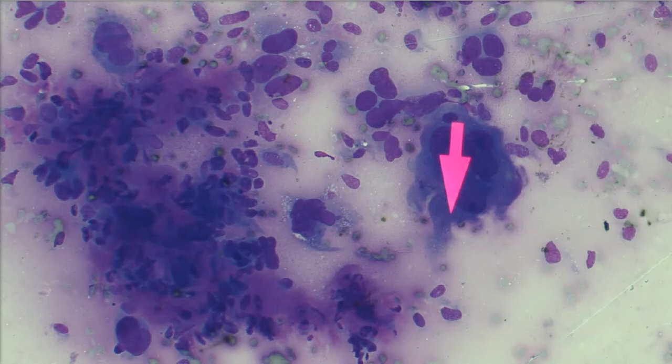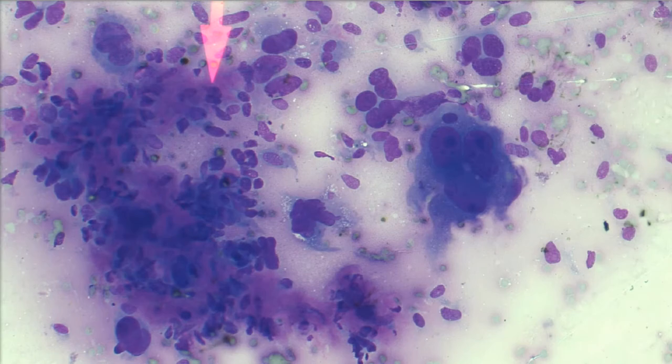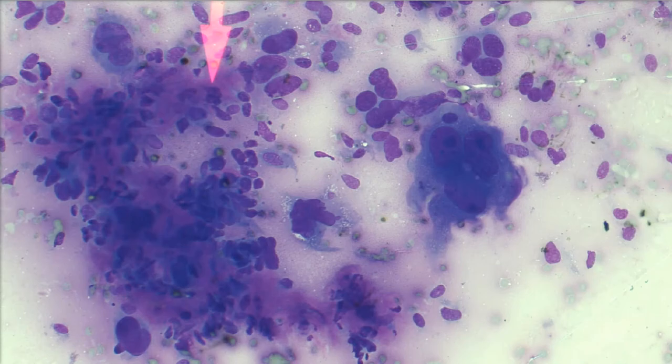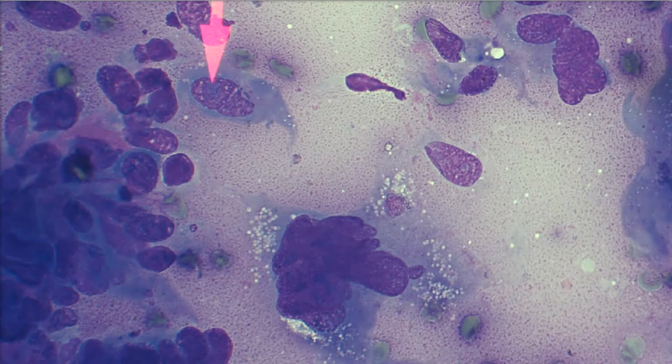You can see this pink extracellular material mixed up — it can be associated with a lot of different types of tumors, but mesenchymal tumors in particular can be associated with this pink matrical type material they're producing. So now we feel good that they're a mesenchymal population, but do we have criteria of malignancy to call these malignant? I think you can already pick up on the fact that they do.